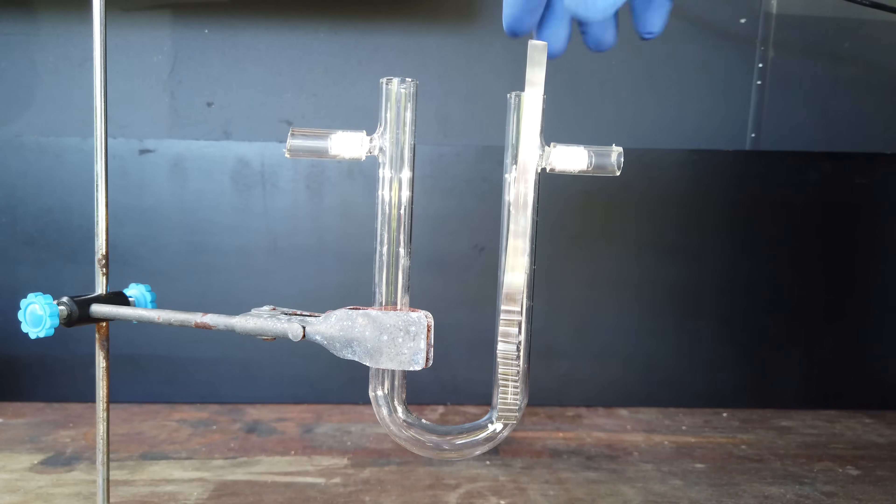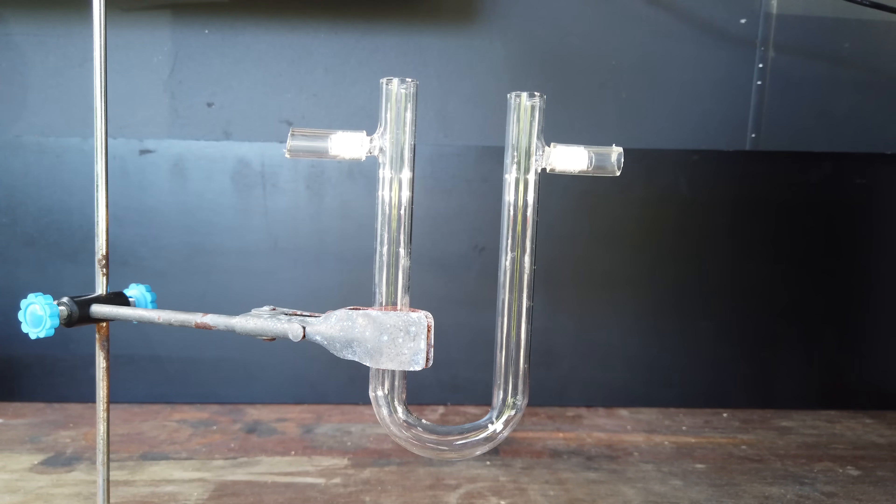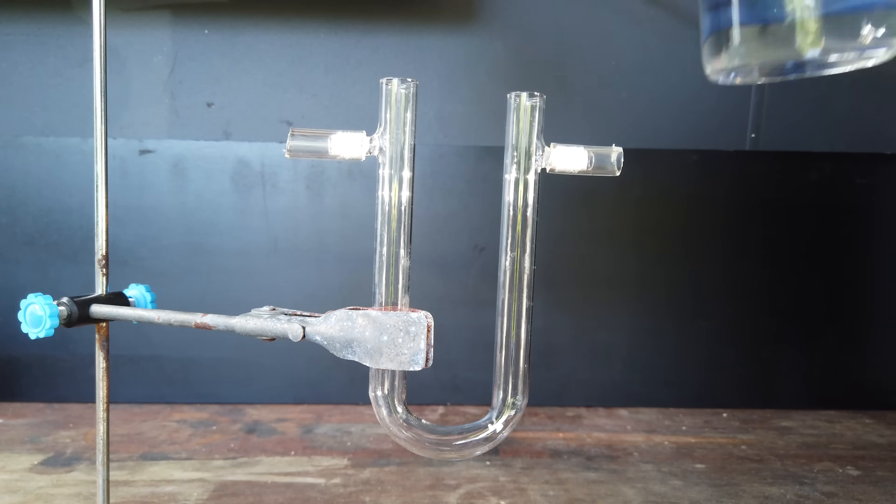It is going to be really handy today, so I'm just going to pour some of our urea solution straight into the U-tube here.